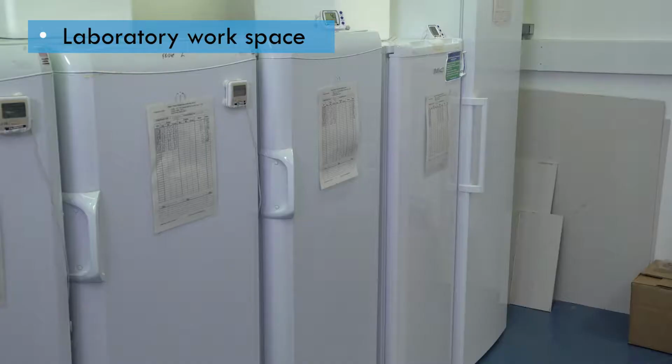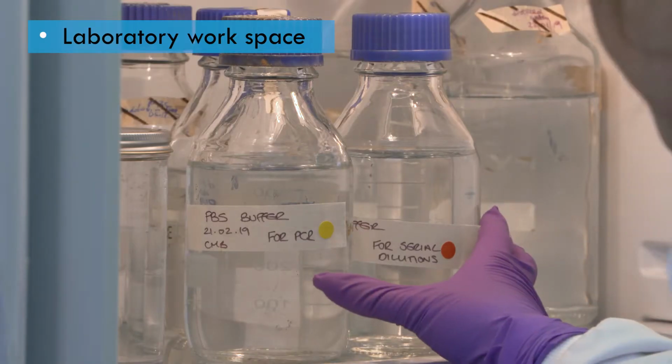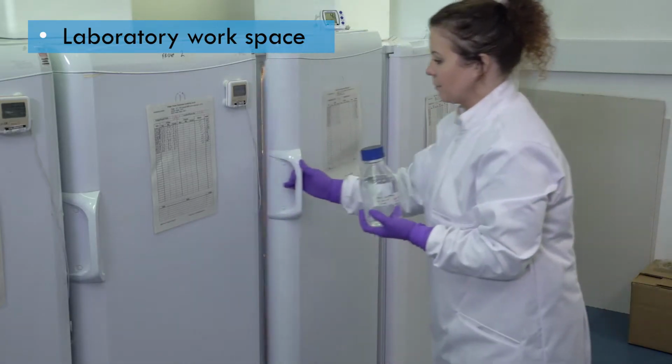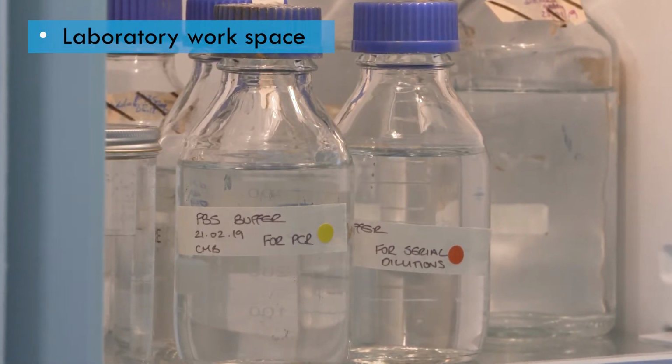Where possible, separate reagents and equipment should be used to avoid cross-contamination. For example, separate dedicated bottles of a buffer solution should be used for work involving live cultures and molecular methods. Here, a color coding system is being used to make identification easier.